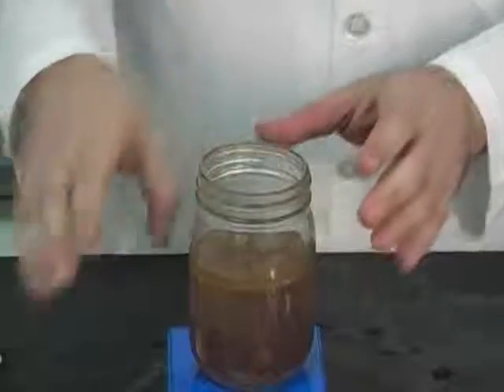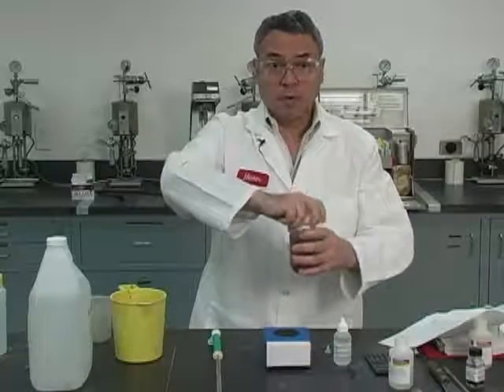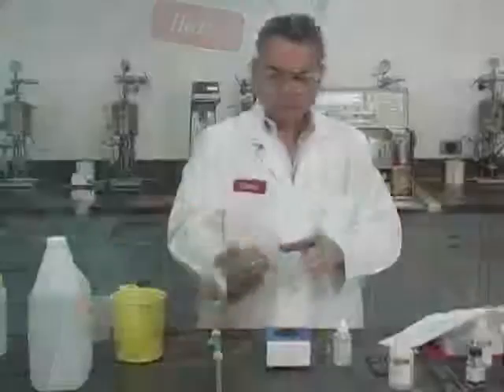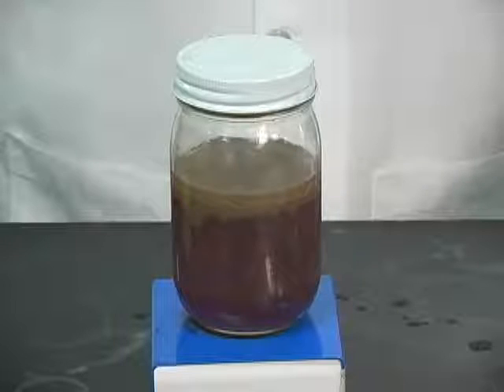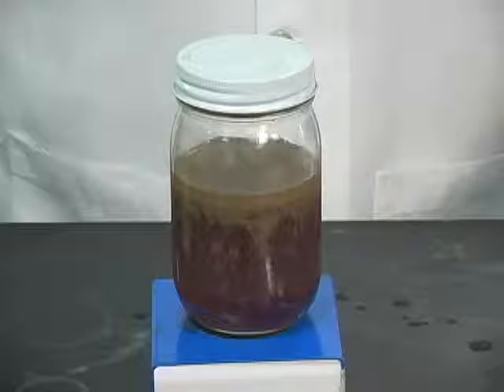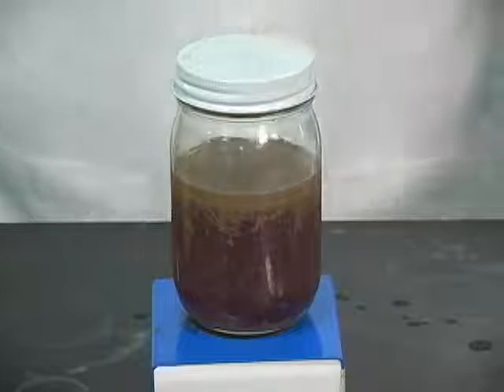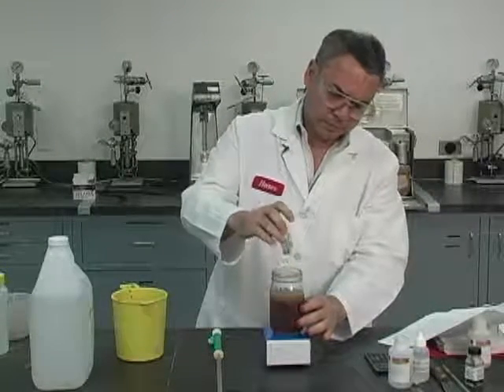You'll probably notice that the emulsion is already broken — that's exactly what we want, in order for us to scavenge all the calcium in the water phase. If we don't break the emulsion, the water phase is hidden — emulsified. We have to shake for about two minutes and let it rest until we see a phase separation. If we see a reddish color, that means we have calcium, as we probably do. You can see that the bottom part, which is the water phase, is reddish.